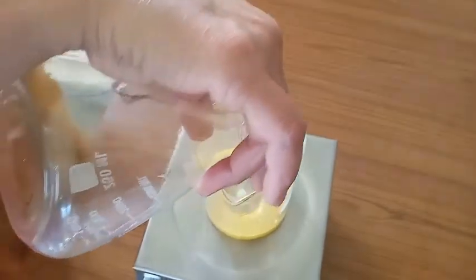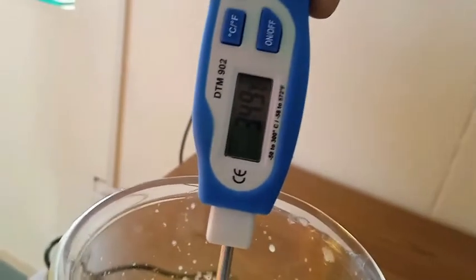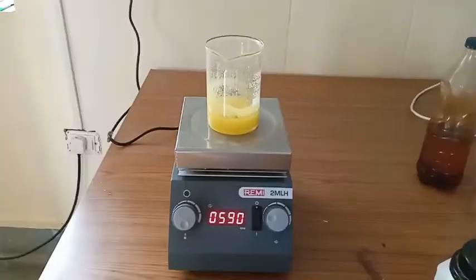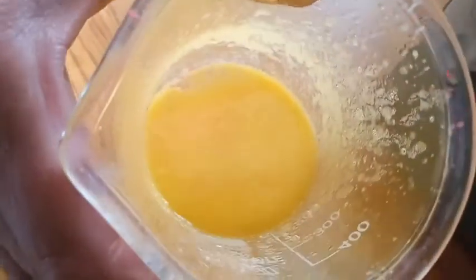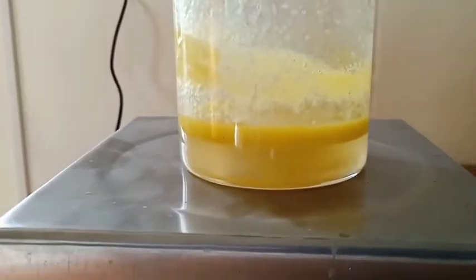You can see the reaction taking place; the temperature reads 34°C. I have added the NaCl salt and after adding NaCl you can see the separation of layers. After leaving it for a few hours at room temperature, you can see how it looks.